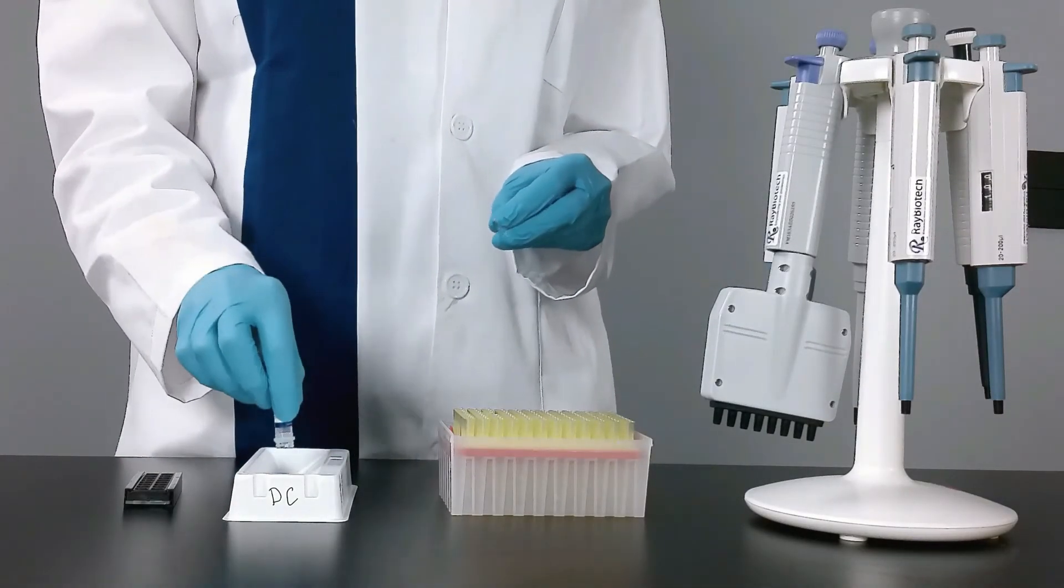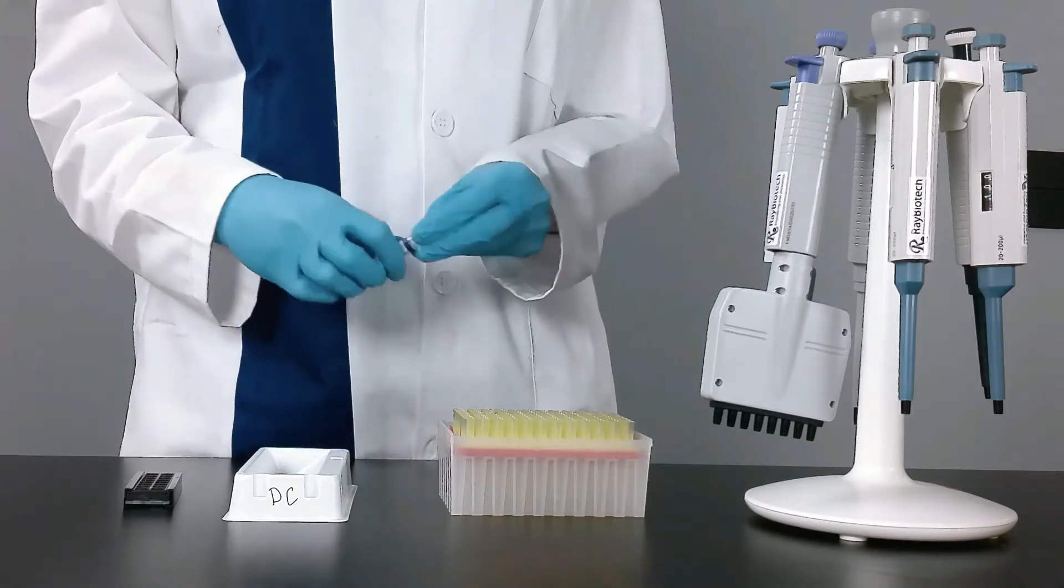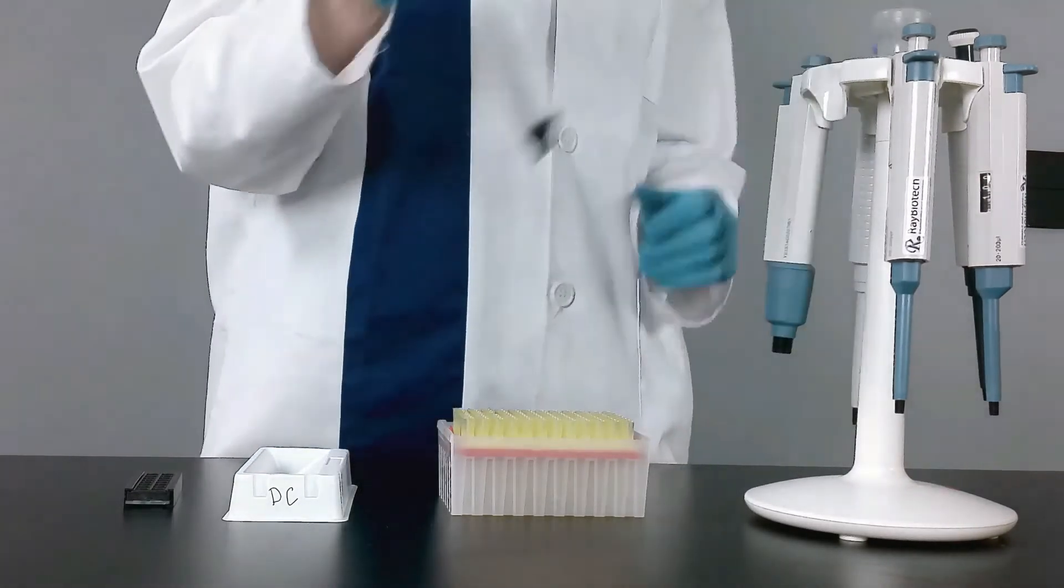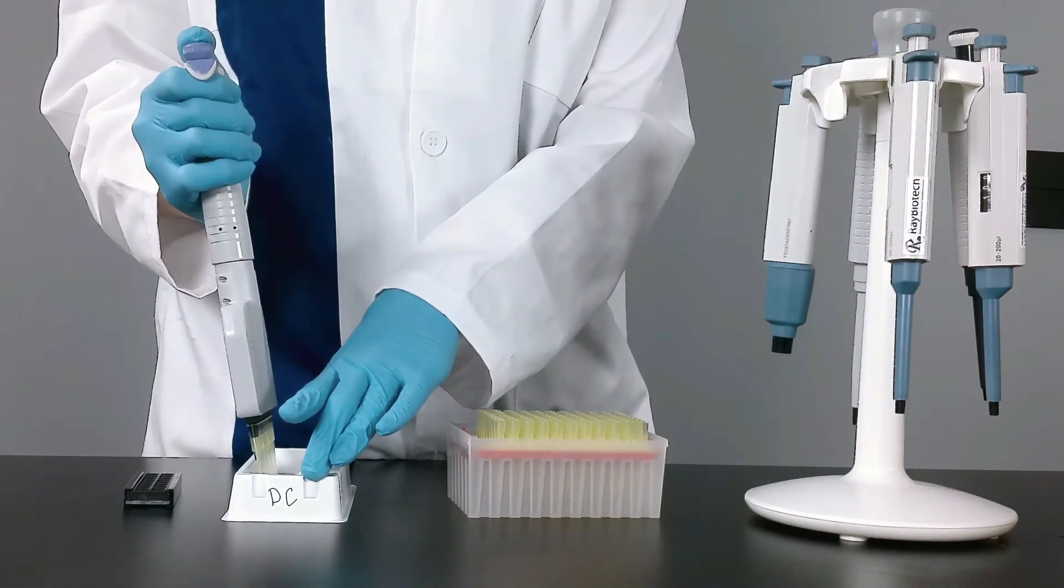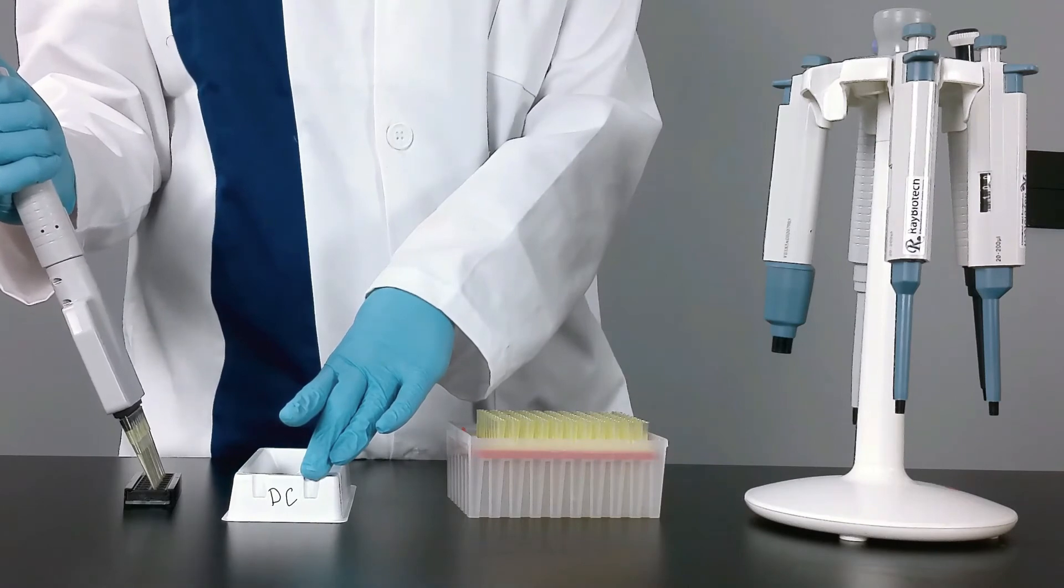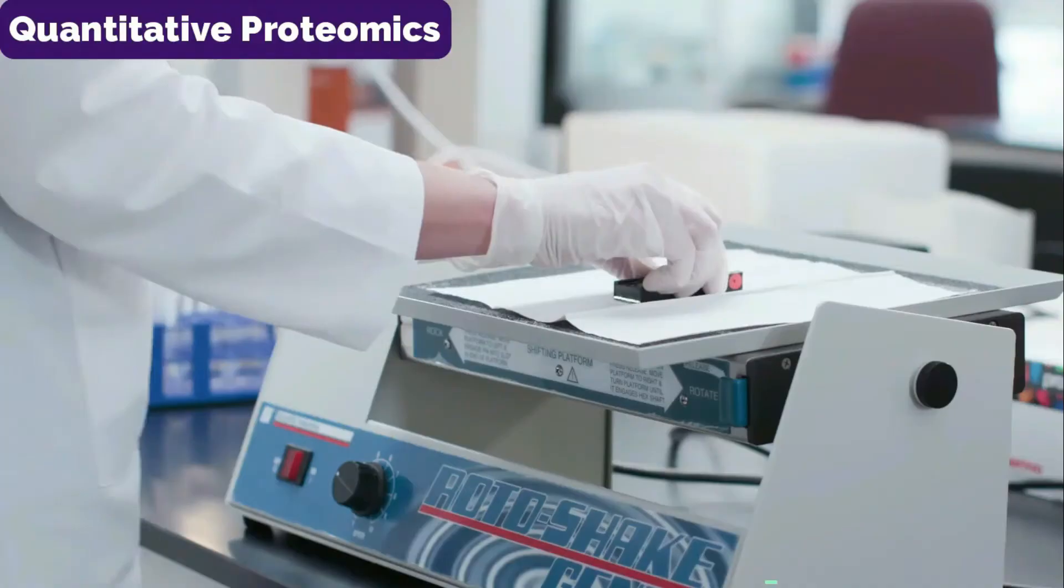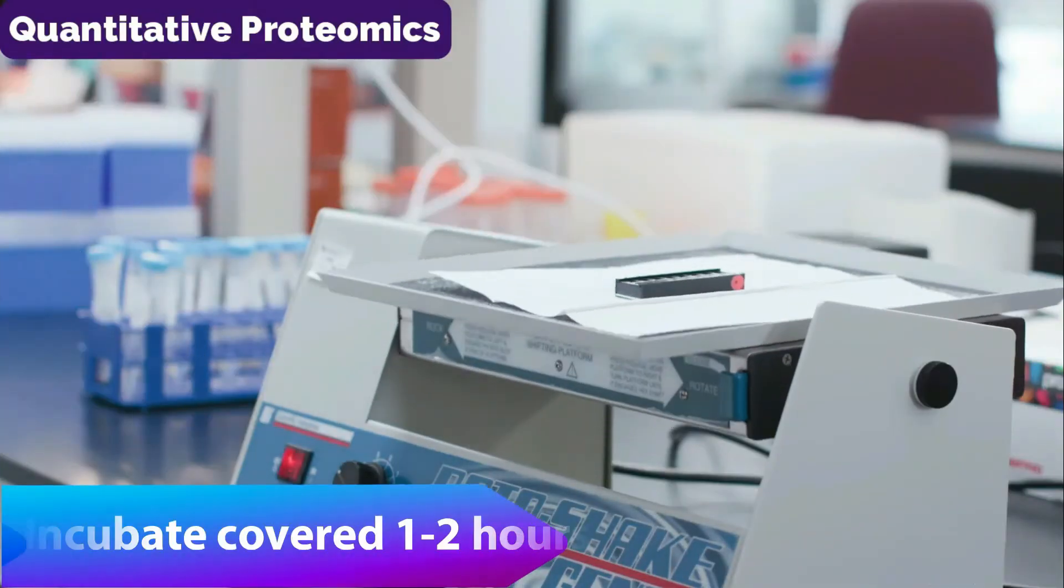Once the slide is dry, you are now ready to put on your detection antibody with 80 microliters to each well. Incubate covered for one to two hours.